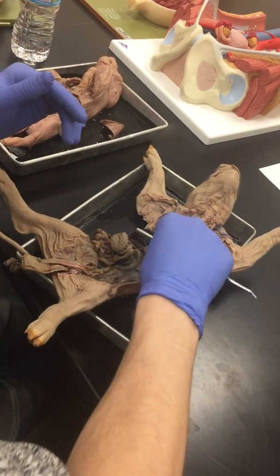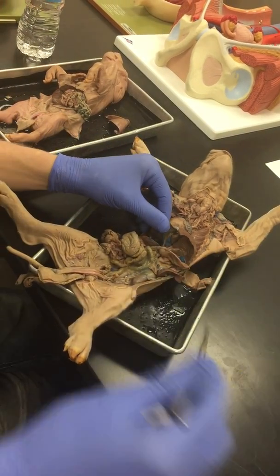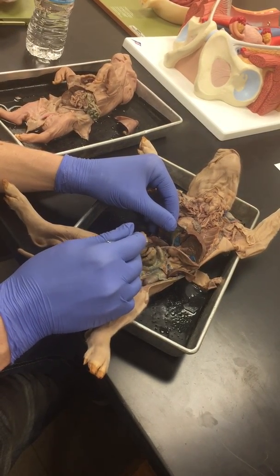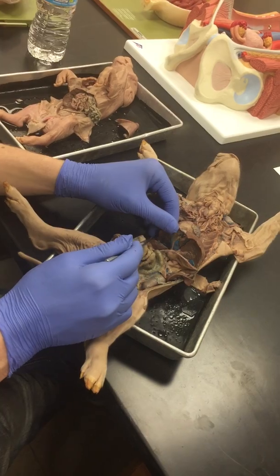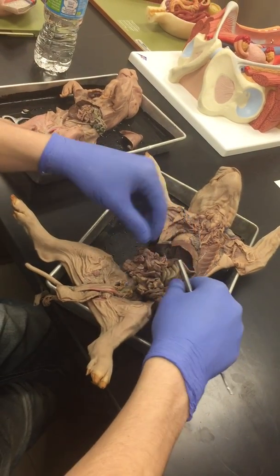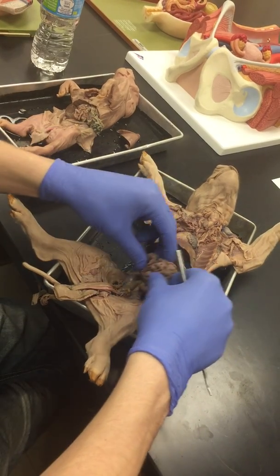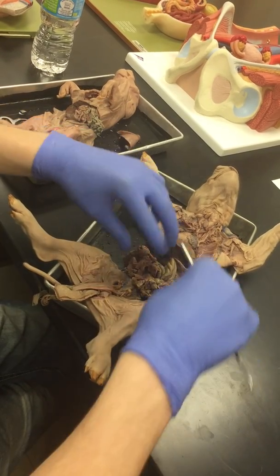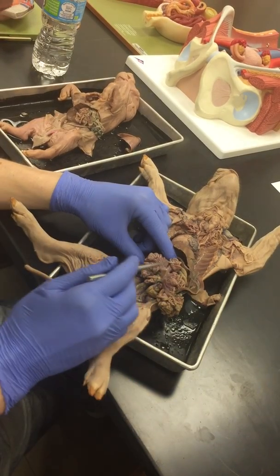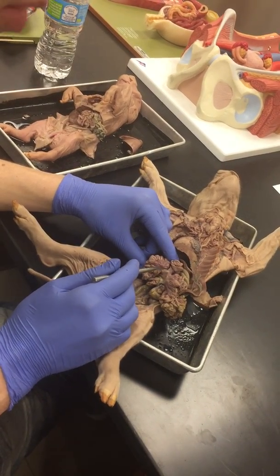So if we look at the extension of the stomach into the small intestines, this tube right here is going to be your duodenum. So they can ask for that specific part. If they put it there, that's the duodenum. If they ask anywhere in the middle here, we're not really going to ask jejunum. This is just small intestines. But really and truly, if they're asking for the structure that's binding it together, this pink material right here, that pink material is the mesentery.